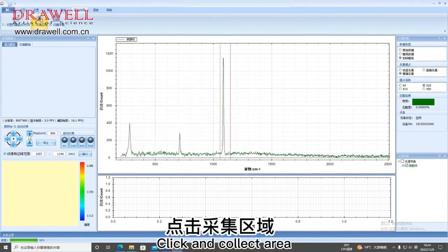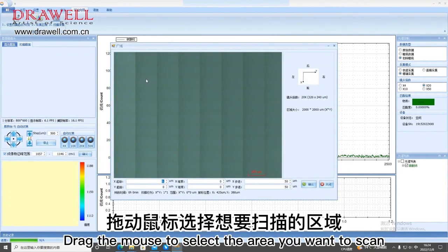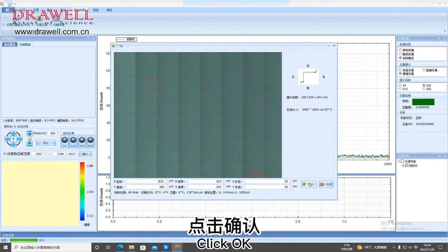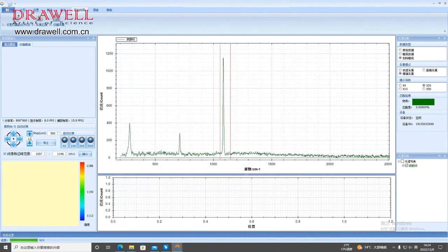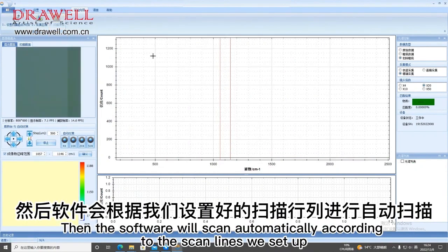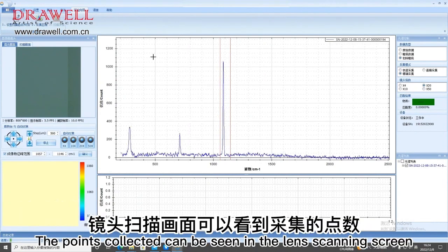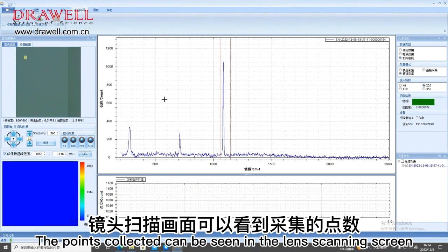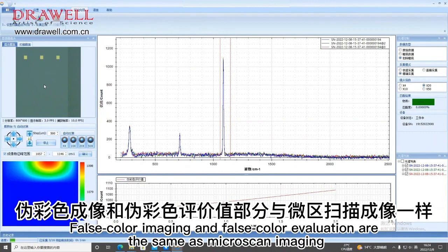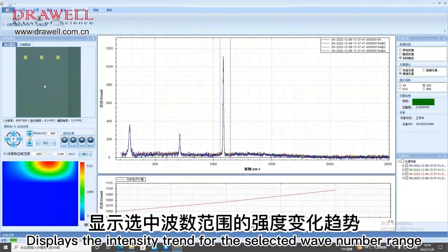Click and collect area. Drag the mouse to select the area you want to scan. You can also select the number of scan points by modifying the XY step. Click OK. Click Scan Capture. Then the software will scan automatically according to the scan lines we set up. The points collected can be seen in the lens scanning screen. Pseudo-color imaging and pseudo-color evaluation are the same as microscope imaging. Displays the intensity trend for the selected wave number range.